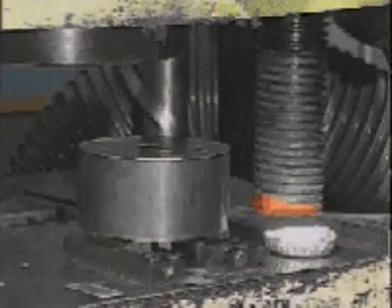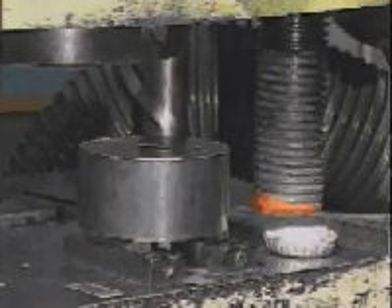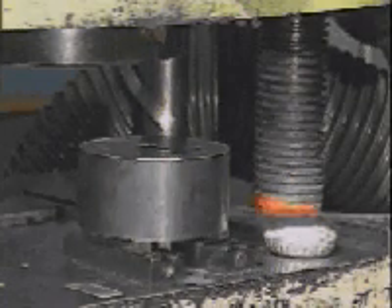This test method has two alternative test specimens. The tooling depicted here makes the rectangular specimen, generally known as the transverse rupture bar. The alternative specimen is cylindrical. The procedure used would be similar but would require a different set of compacting tools.